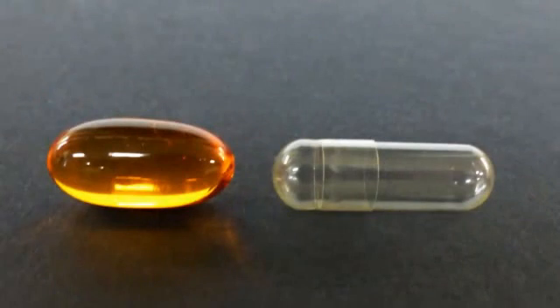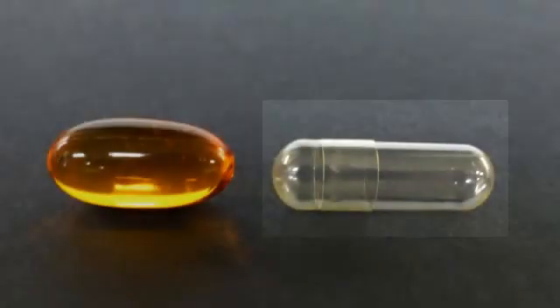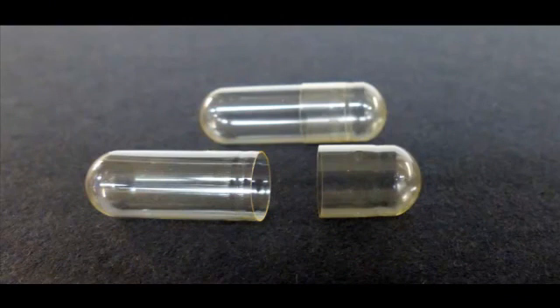Commercially, there are two types of capsules available: soft gelatin and hard gelatin. The type of capsule used will depend on the contents of the capsule. In the Pharmacy Skills Laboratories, we will only be using hard gelatin capsules.